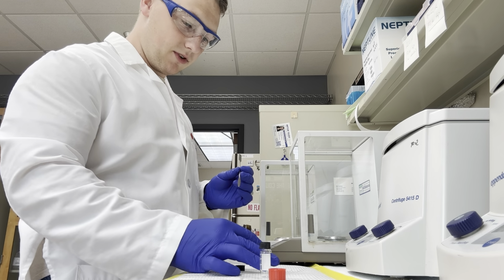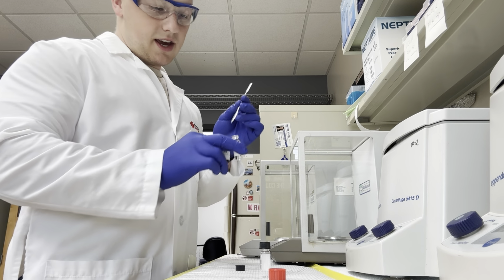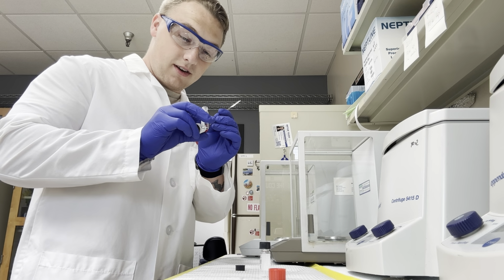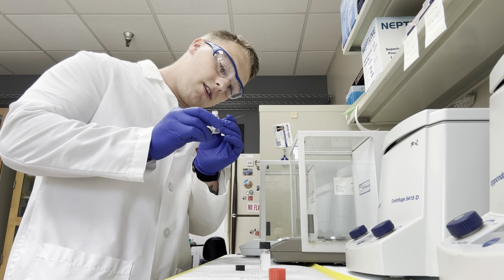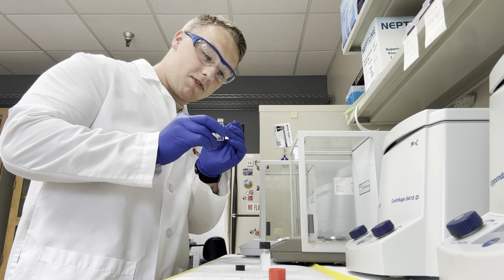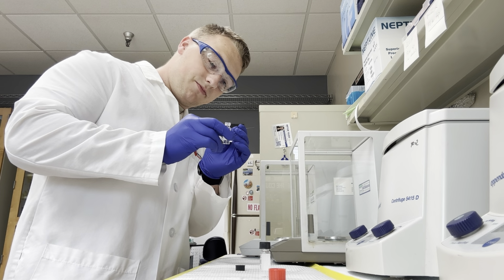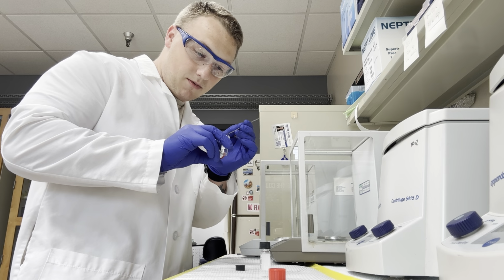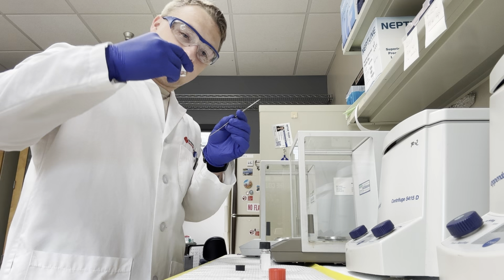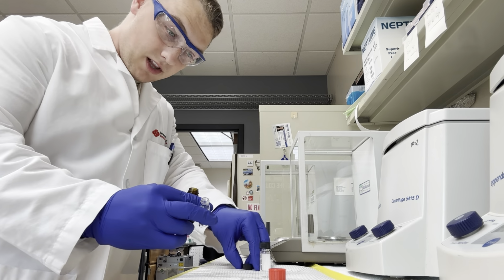Now we're going to pick up our sample from its stock and our vial in the other hand, like so, and we are going to try and get some of this material out. Typically for these concentrations, we like to get around 10 milligrams if we can. Sometimes we can't, that's okay, but 10 mgs is about where we want to get. Just going to lightly dispense it there. Now this particular sample is fairly clumpy.